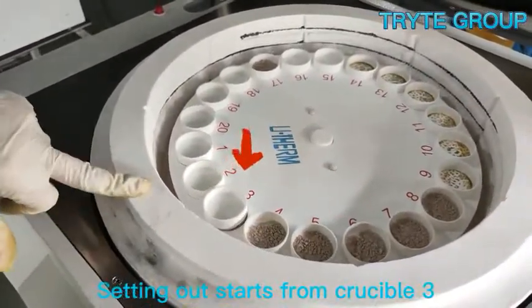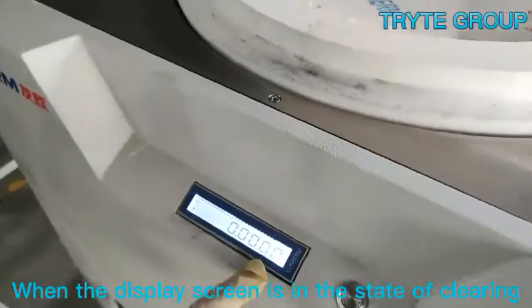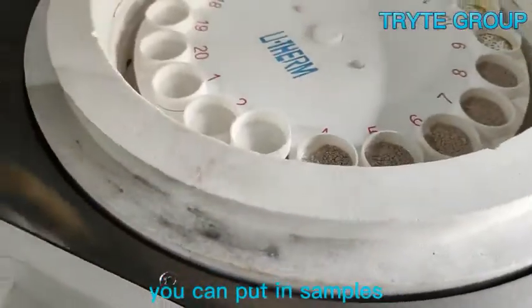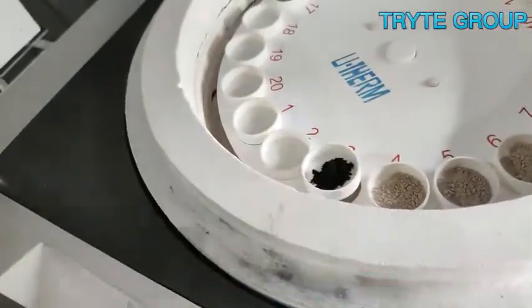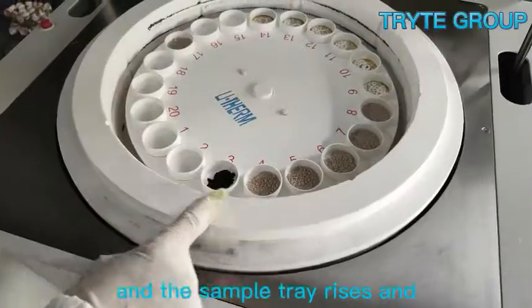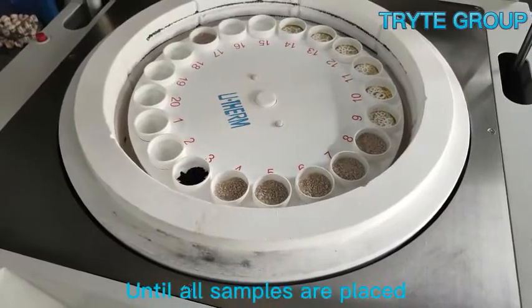Setting out starts from crucible 3. When the display screen is in the state of clearing, you can put in samples.